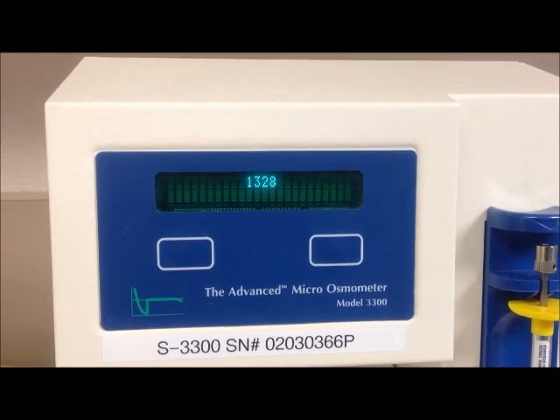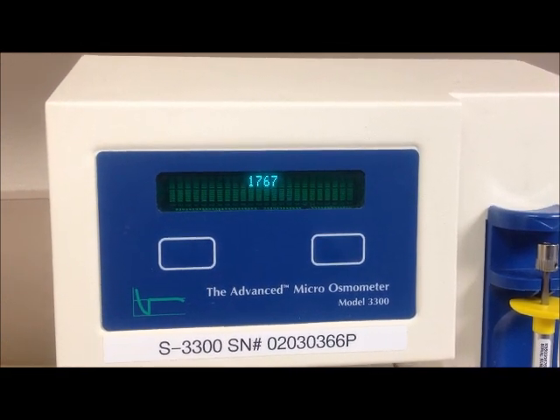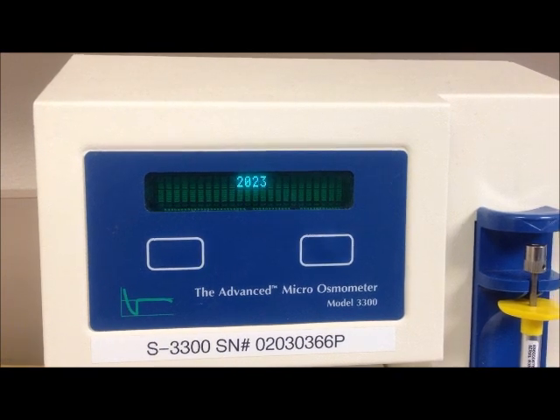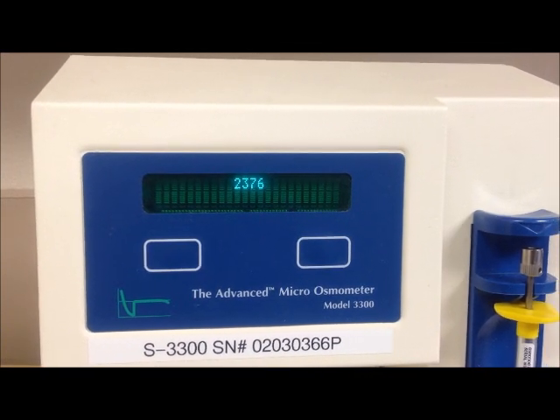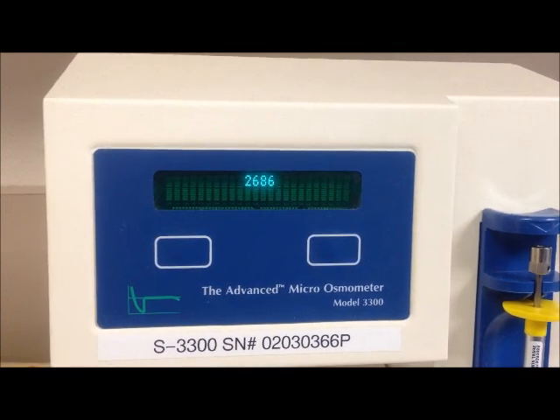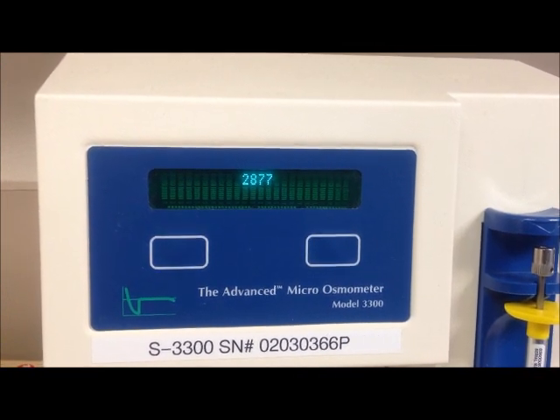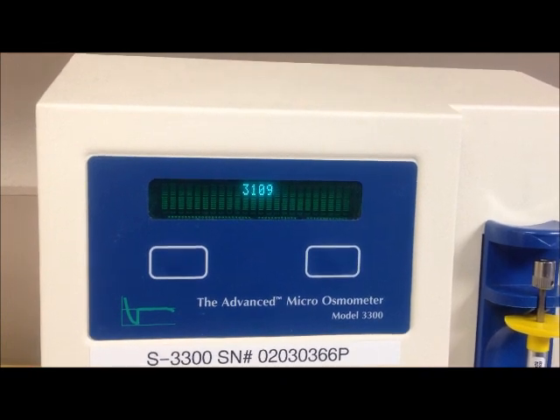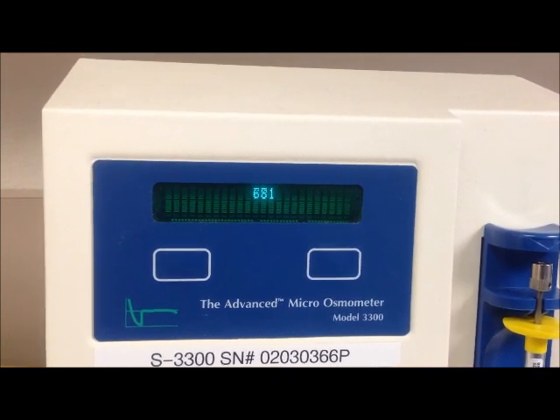The instrument will now run the test for approximately one minute. The osmometer will display the result in milliosmol. The osmolality of the sample used here is 634 milliosmol.